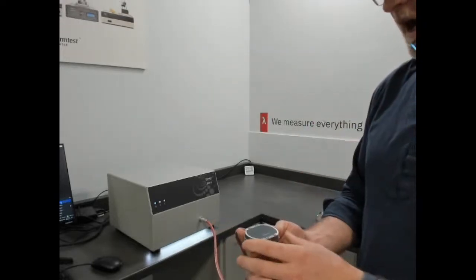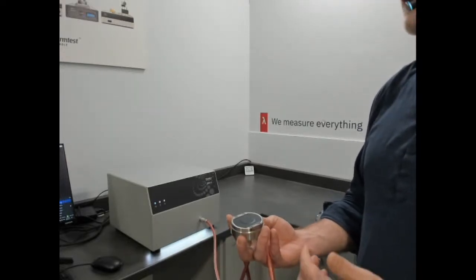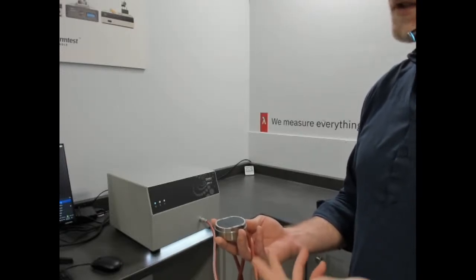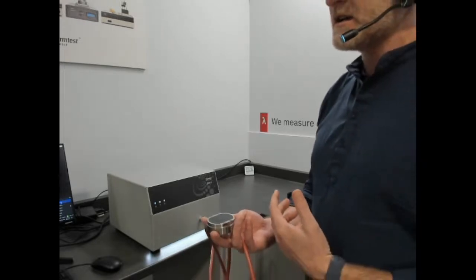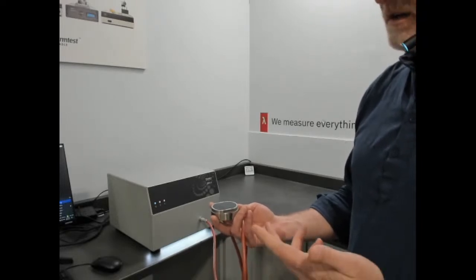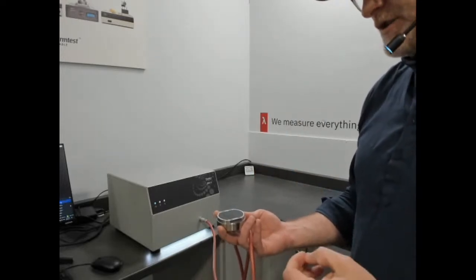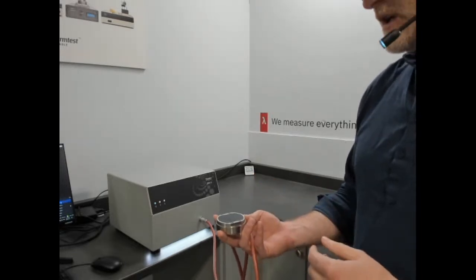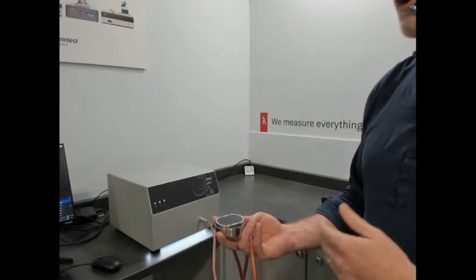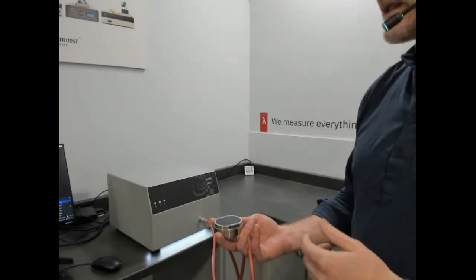So the ISO 22007-7 expands in a much better way on thermal effusivity. And why I'm describing it as a much better way is it's taking the absolute method of transient plane source, which is the classic technique, double spiral, following ISO 22007-2. It expands on that to describe effusivity in a much more accurate way based off the application. Inside that standard, and I encourage you to look at it, we'll put the link to the ISO and you can purchase the standard to read it yourself.